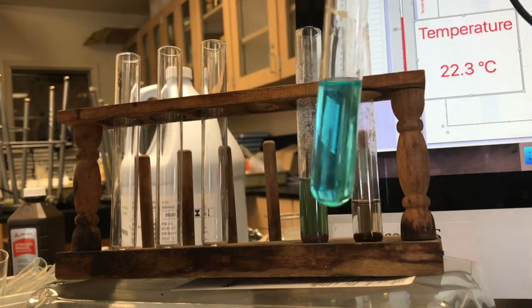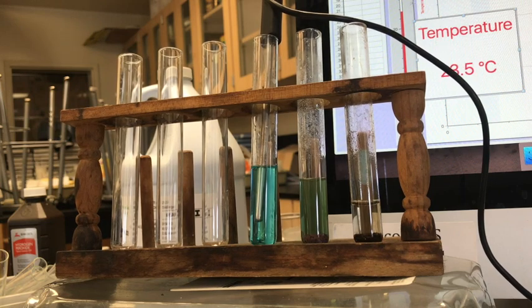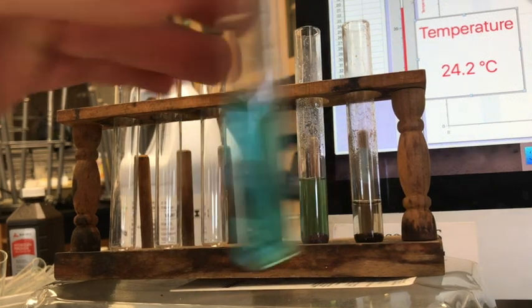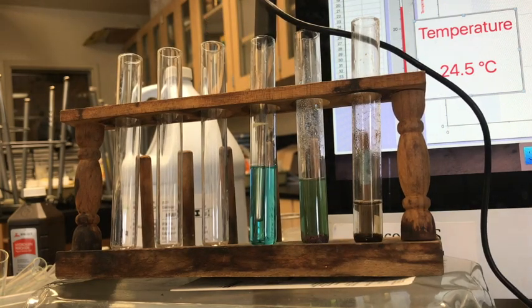And there we go. See if we got a temperature change out of that. Remember, it was about 23.6. I think that's enough to say it went up a little bit. Yeah, definitely. Almost a whole degree. Not as drastic as the previous ones, but we went up a whole degree during that change.